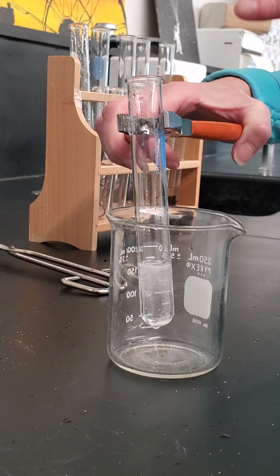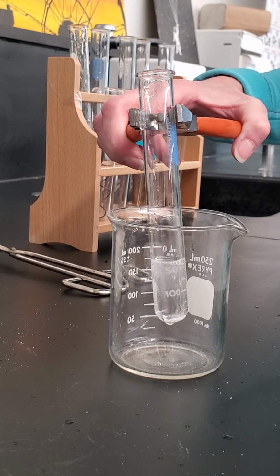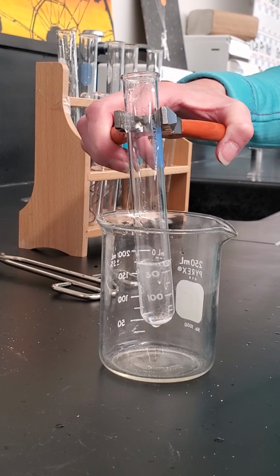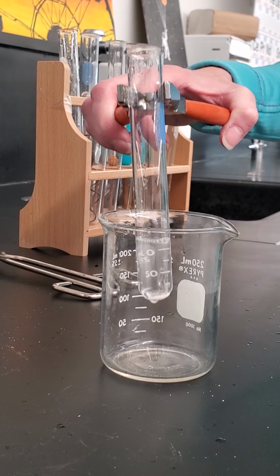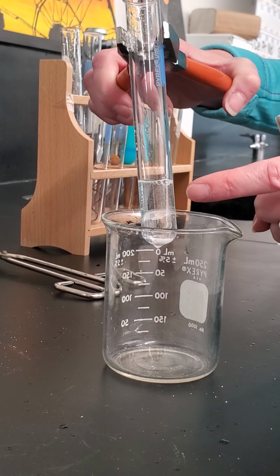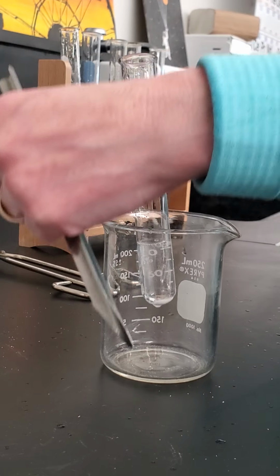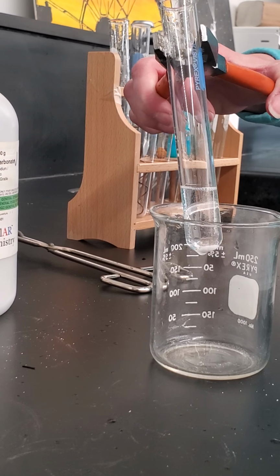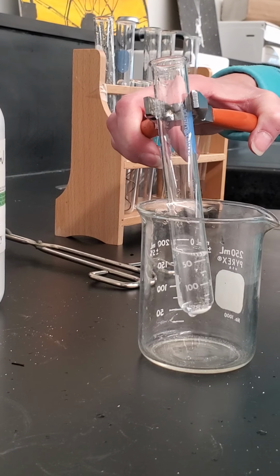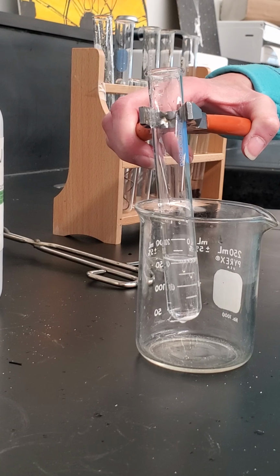But it's the hydrogen carbonate that broke down really, really fast and caused that carbon dioxide to form, which is causing all the bubbling and overflowing, and then we have water left in solution. So in this solution, we have water and sodium sulfate. Those are the two things that are in solution, and then we have carbon dioxide gas given off very rapidly.